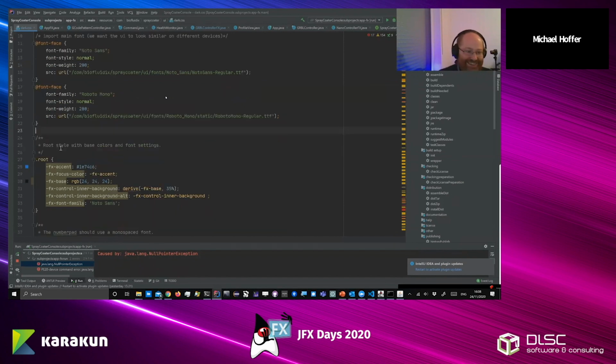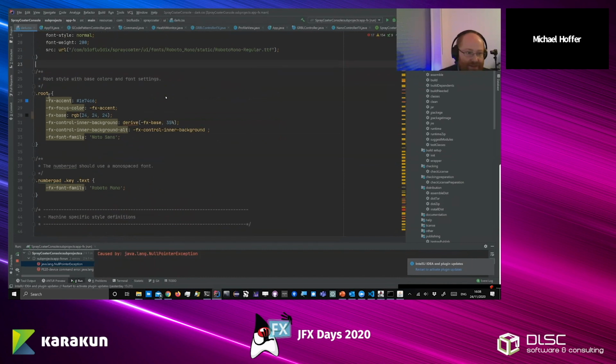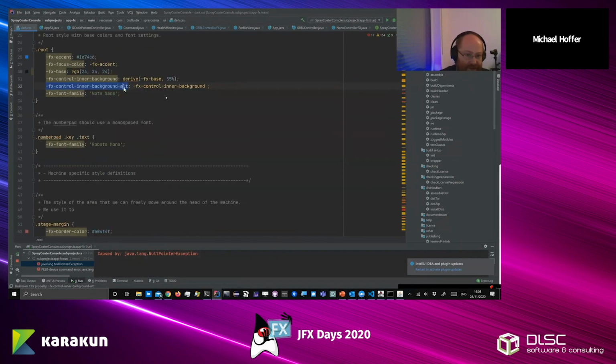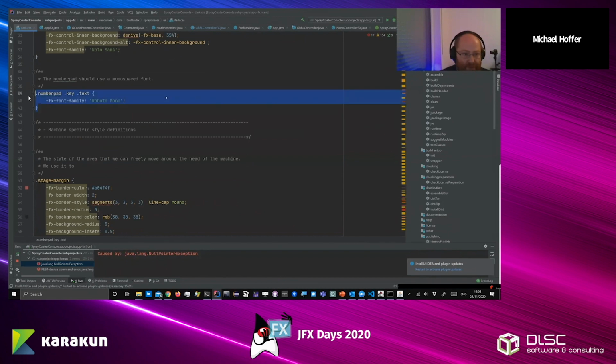So here, in our root style, we just changed the accent color and the base color. This is a rather dark one, and then we derive certain background colors, and we have the alternate. So if you have a list view or something, you could have alternating backgrounds if you wanted. And we set a default font family. And for the number pad, we use a monospaced font.